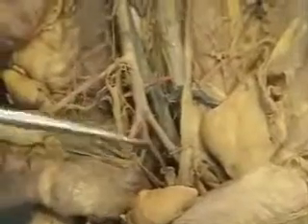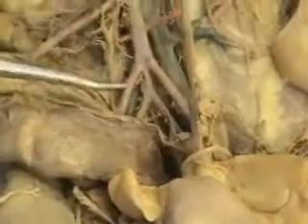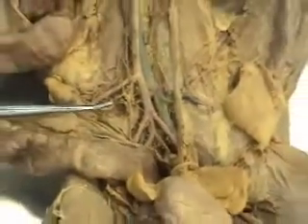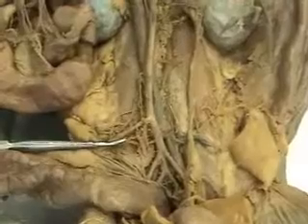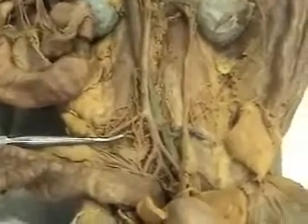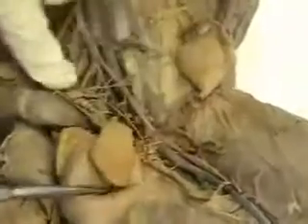Now in the cat, slight difference from human, there is a right external and a left external iliac artery. The internal iliac arteries are a little bit lower down in the cat. They're right down here. The right and left internal iliac supply oxygenated blood to the organs of the pelvis. In us, slight variation, there's a common iliac that then bifurcates into an external and an internal. But again, in both cat and humans, the external iliac carries blood to the legs, the internal iliac carries blood to the pelvic organs. And if we follow this external iliac right here, this is the right external iliac.